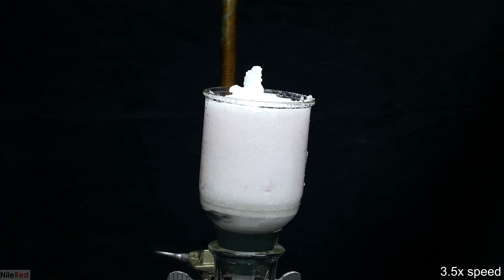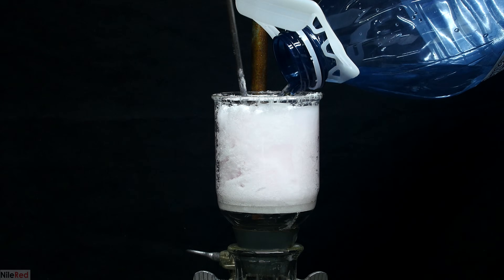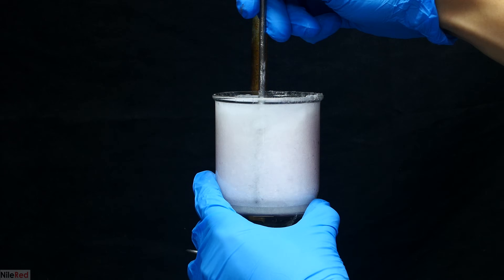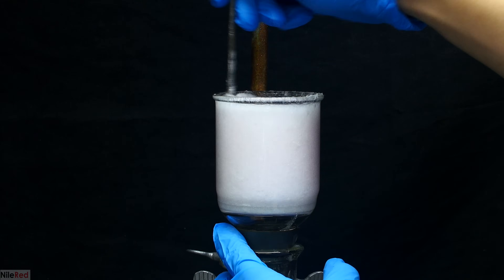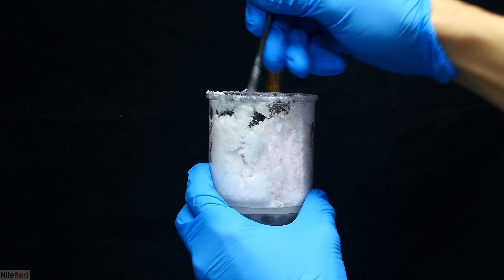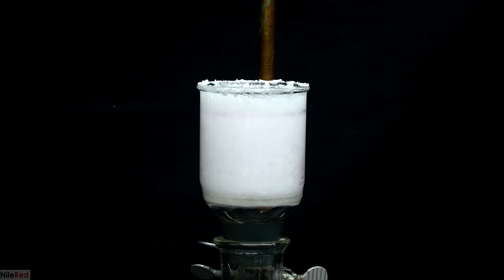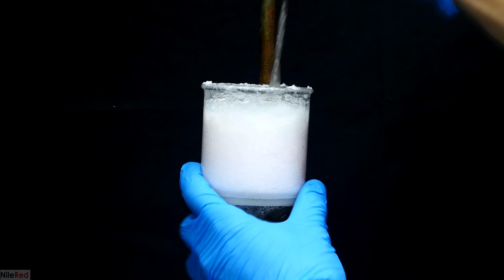Most of the water is pulled off and then I wash the ASA a few times with distilled water. Enough distilled water is added to cover the crystals and then, using a spatula, I mix it around to make sure all crystals are washed thoroughly and to break up any chunks. The amount of water used here isn't too critical, but it's best to use a minimal amount. After washing two or three times, I keep the vacuum on for several minutes to get the crystals as dry as possible. The ASA is then dumped onto a piece of paper to dry, and I start filtering off the rest of the crystals in the same way.